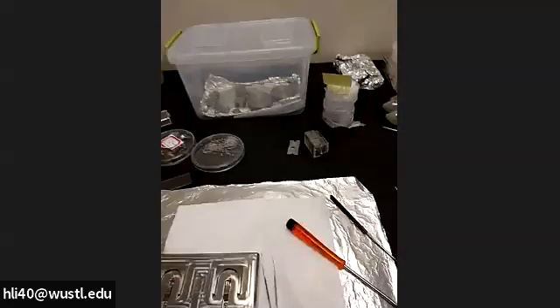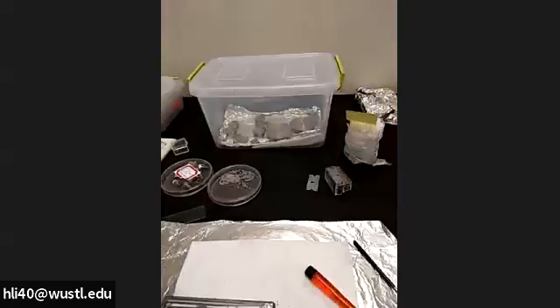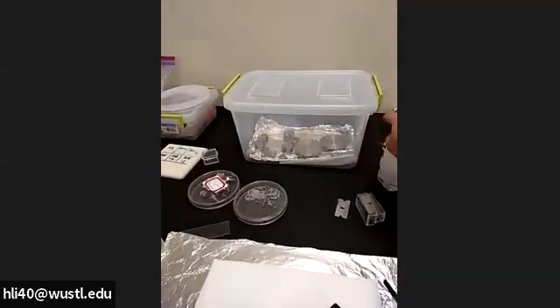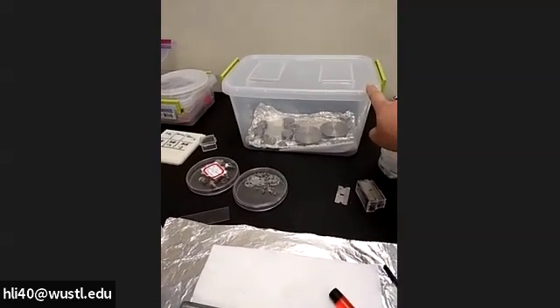Sample mounting for XPS experiment. We have this sample box here, a holder box, and all holders after use are supposed to go back to this box.